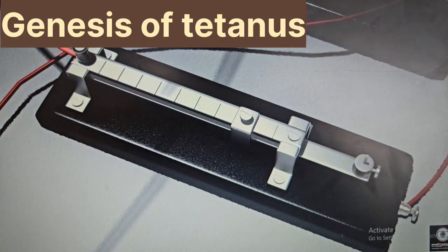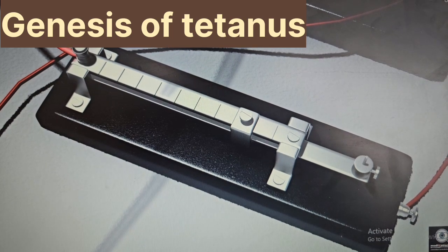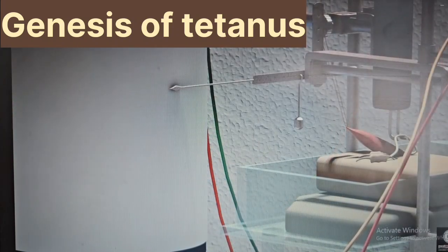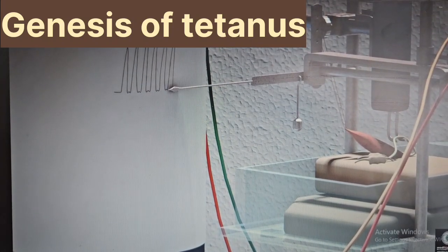We set up the nerve muscle preparation like the muscle twitch experiment. The interrupter is set to give 5 interruptions per second. So there will be 5 stimulations of the nerve per second. The nerve is stimulated 5 times per second and the contractions are recorded.